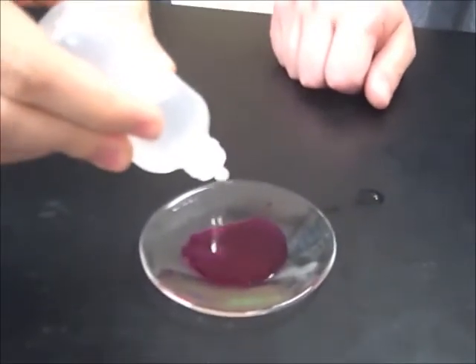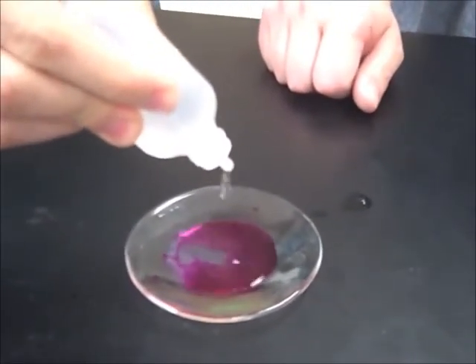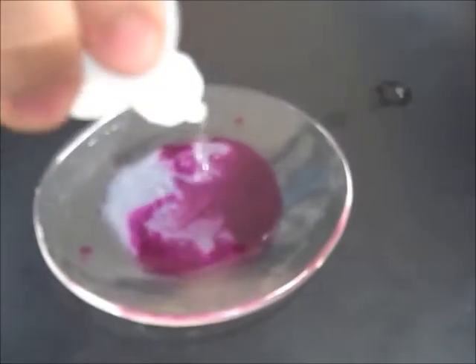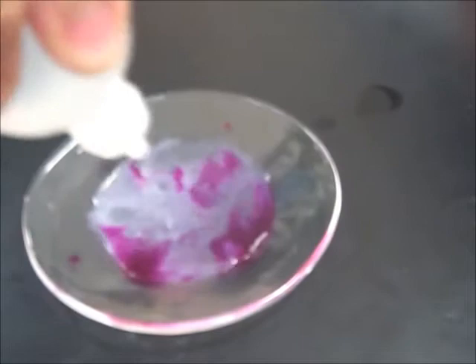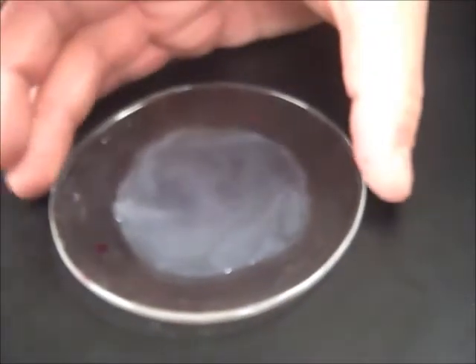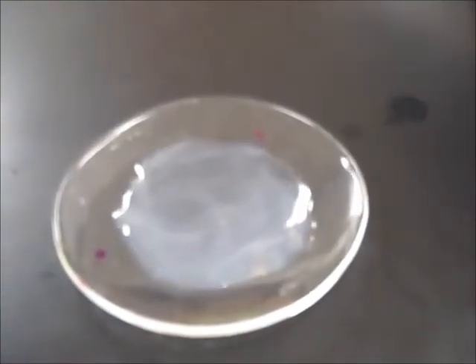Now Nick's going to add the acid to this sodium hydroxide. Keep on adding. Oh, look what happens when he adds. It starts to separate and clear up, right? You can add some more. Technically they're supposed to keep on adding acid until the color leaves. That's how we know that we added enough and we neutralized it. We changed that acid and base into salt and water. It's pretty impressive. Oh yeah, it's magic. Must be chemistry.